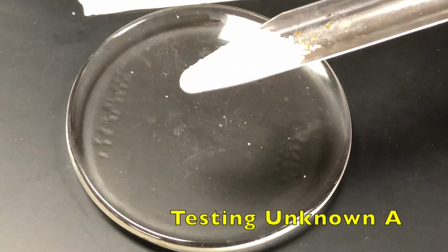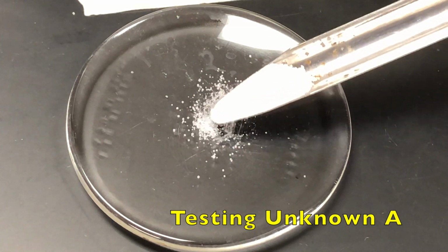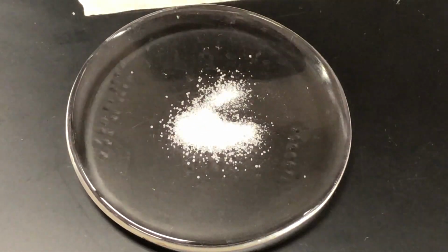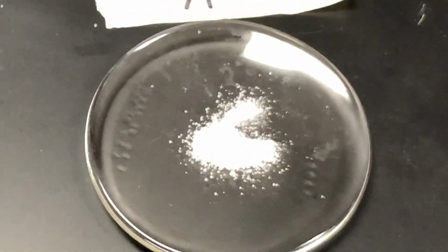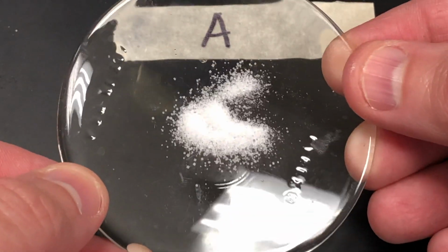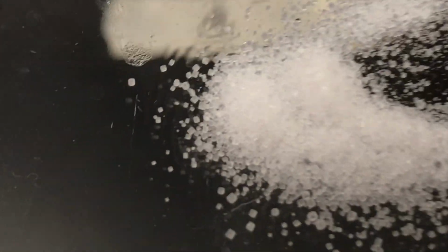Okay, so according to the instructions, you take about a pea-sized amount, which is about this much. This is A, by the way, in case you can't tell. There's A. All right, and as you can see, if I can get a good close-up of this, you can see what it looks like.